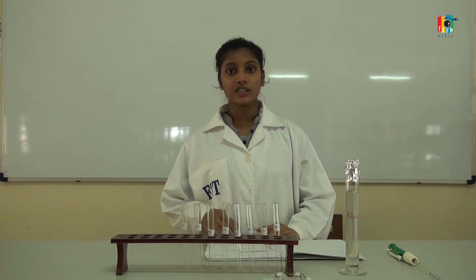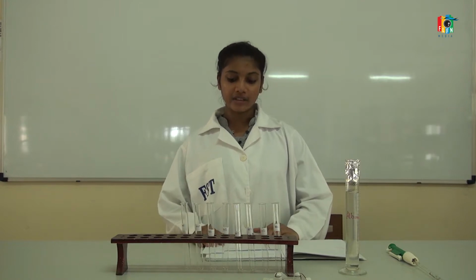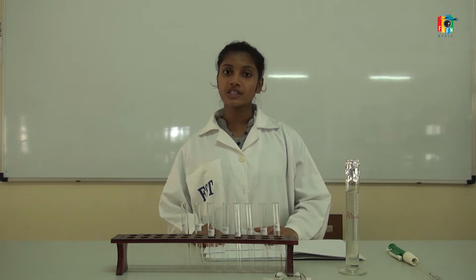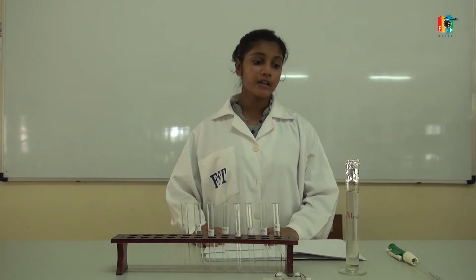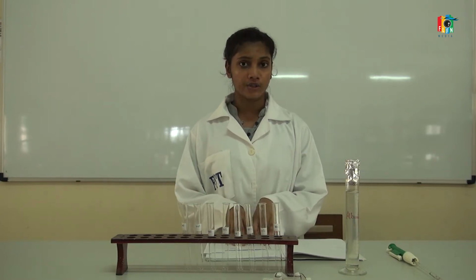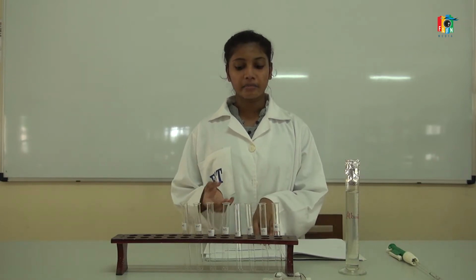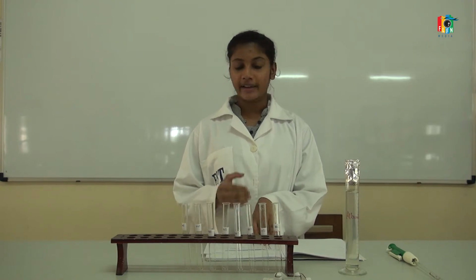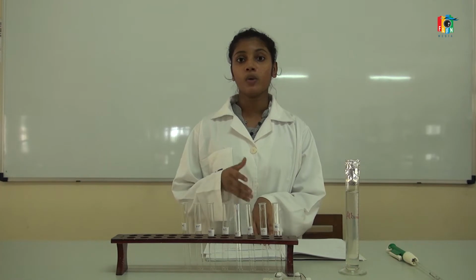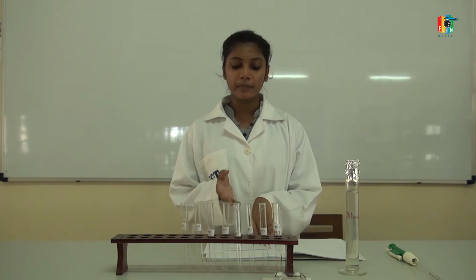In this practical, you are going to determine the effectiveness of heat, ion concentration and pH on the functional properties of protein. So in this practical, we use a 10% albumin solution and we measure how heat, ion concentration and pH affect the coagulation or denaturation of the particular protein.